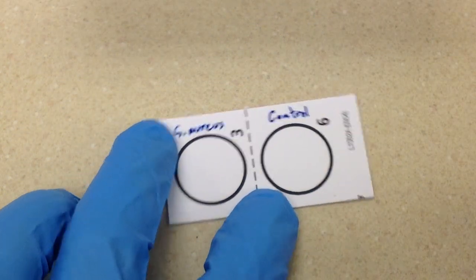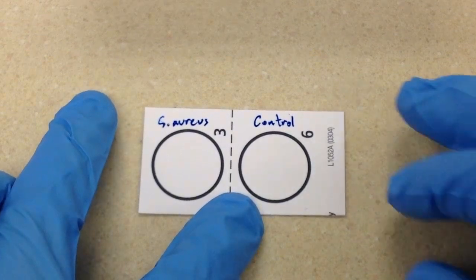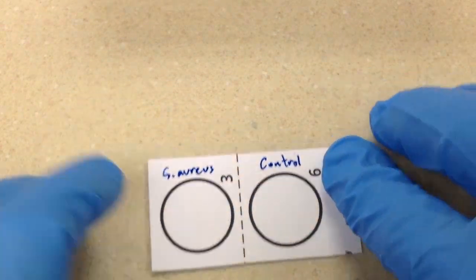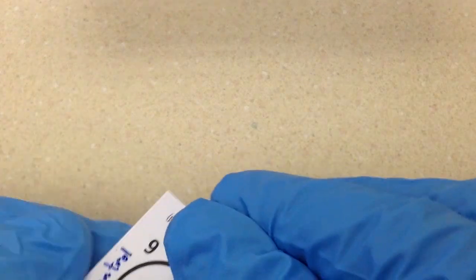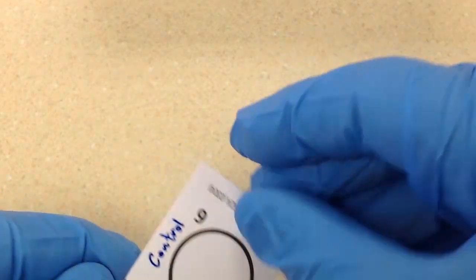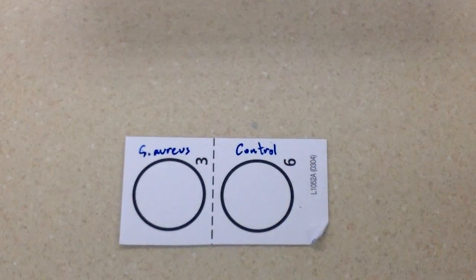Whenever I'm running these card tests, you usually start working on a flat surface and then have to pick them up. So I usually take a corner and just bend it up a little bit, so when it comes time to pick it up it's much easier to handle.